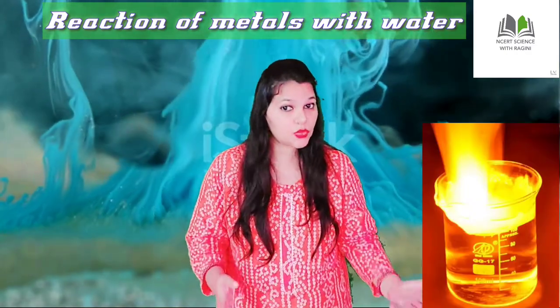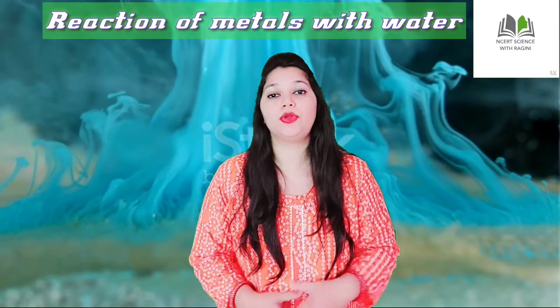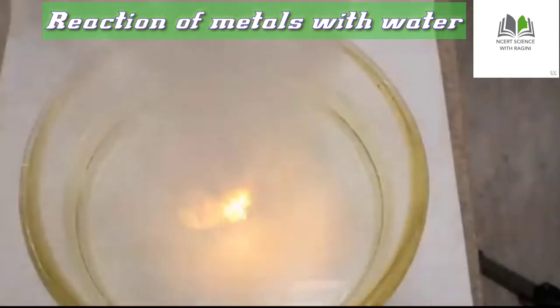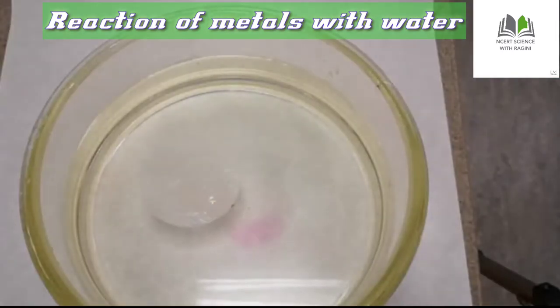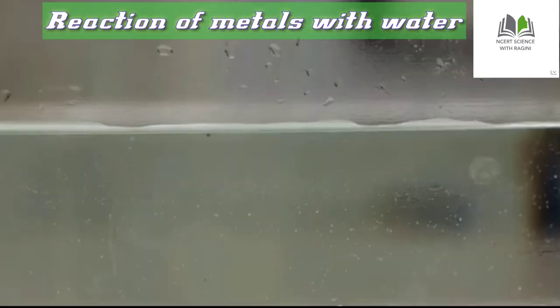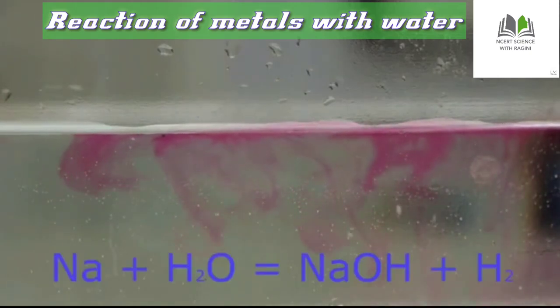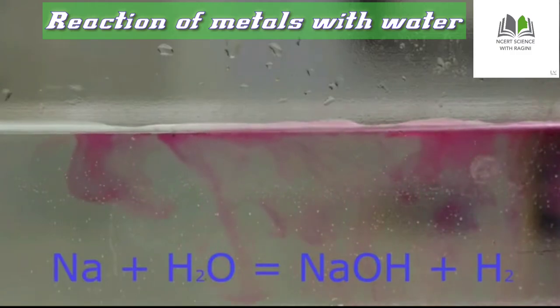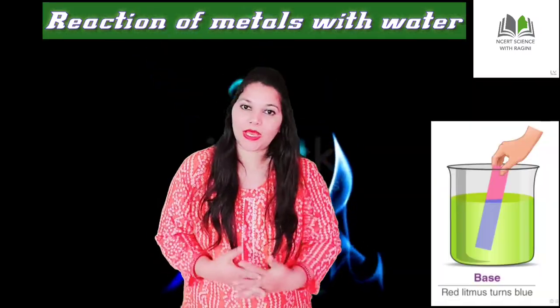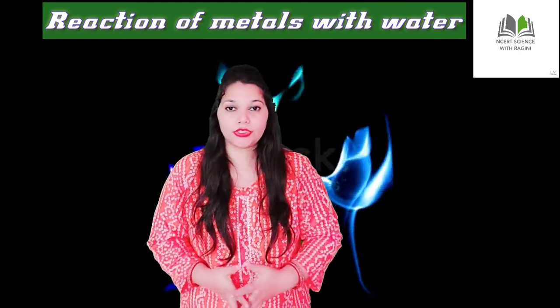Heat is produced because the sodium metal burns. It burns quickly and produces a golden flame. Then we check the solution using red litmus paper — the litmus paper turns blue. This means a basic oxide or basic hydroxide has been formed, so the solution is basic in nature.